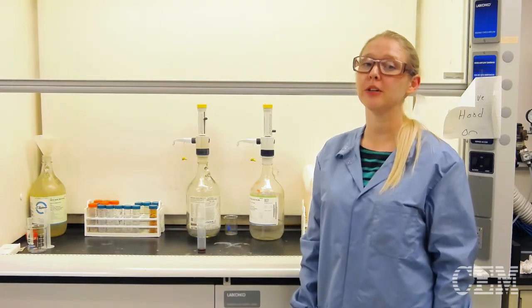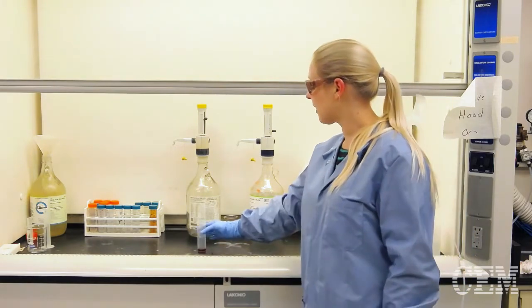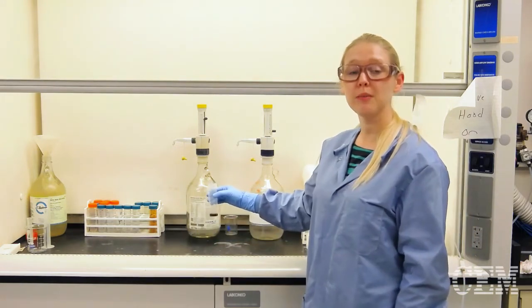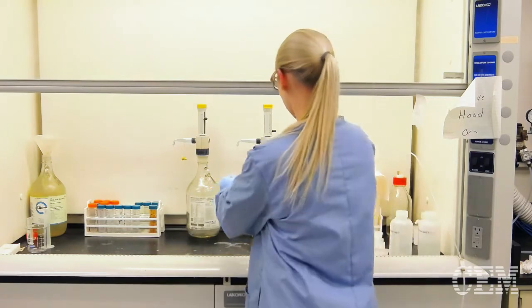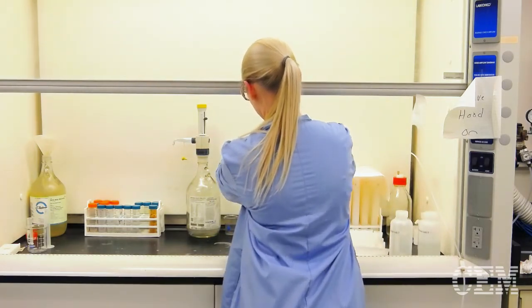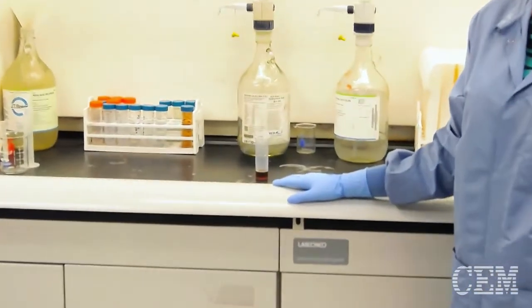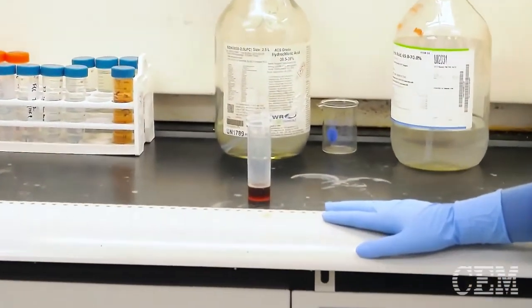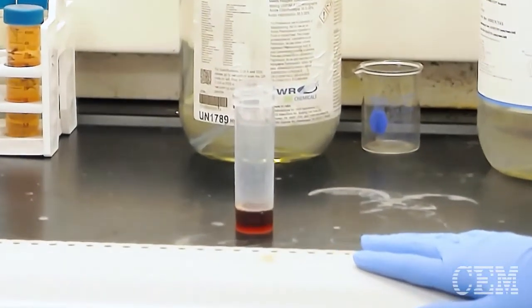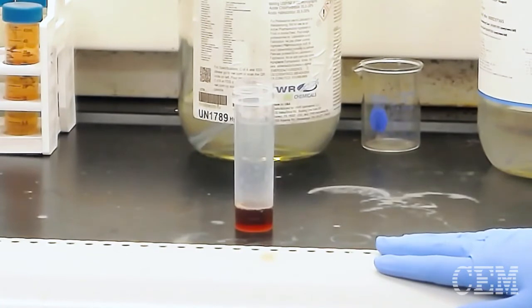Today I'm going to talk about predigestion. For demonstration purposes, I'm going to add some nitric acid to some pre-measured wine. And we want to make sure that we let this sit in an open fume hood. Normally we would do this inside of a vessel, but for clarity and for visual purposes, we're doing it in a digitube so that you can see what's actually happening.